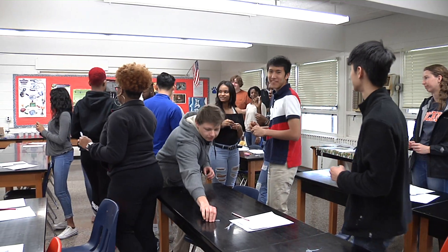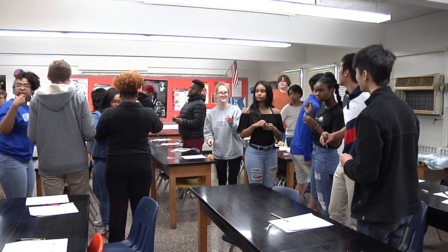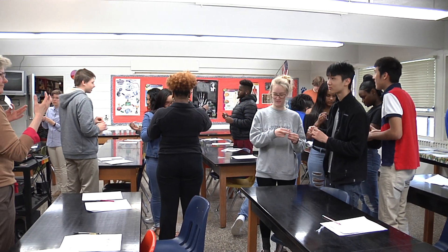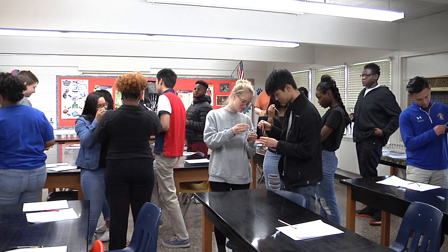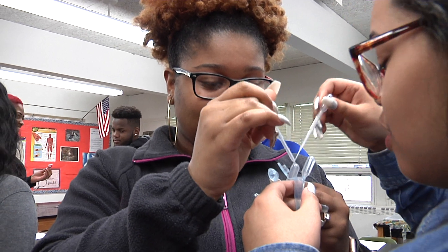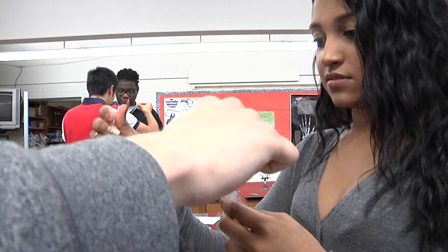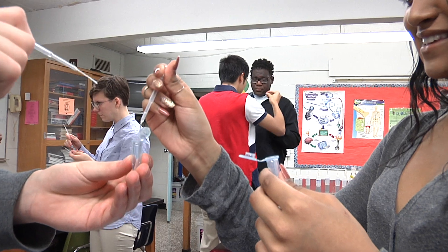How much do you take? Mix it — put it all together as much as you can back and forth until it's one solution. You can use the pipettes, or you can pour if you want. When you're done with that pipette, you're going to throw that pipette away. So you've thoroughly mixed your saliva with that one person — you don't mix with anyone else just yet.